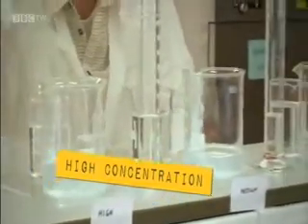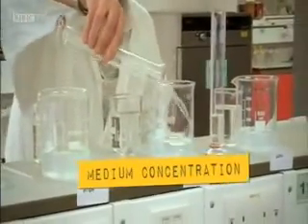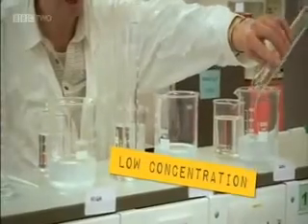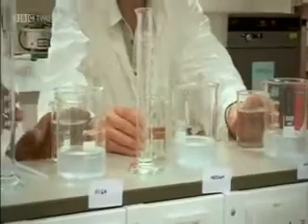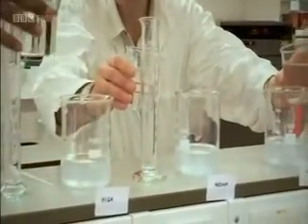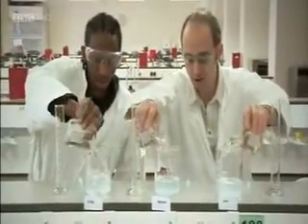We're going to set up these three reactions. This one's going to be the high-concentration one — you can see there's more stuff in it. We're going to put a medium one, and then finally a low-concentration one down at the other side. This is going to be like a race. We're going to start them off, and when we get to the end of the race, the solution's going to turn blue. Are you ready? Steady, go.